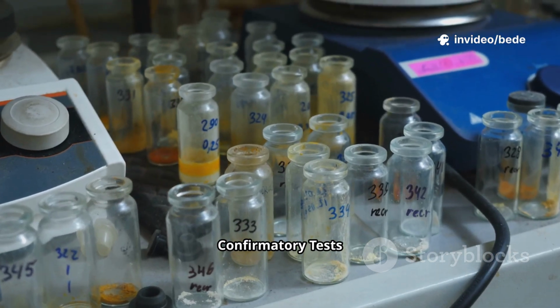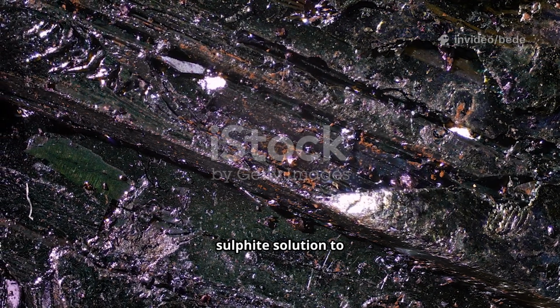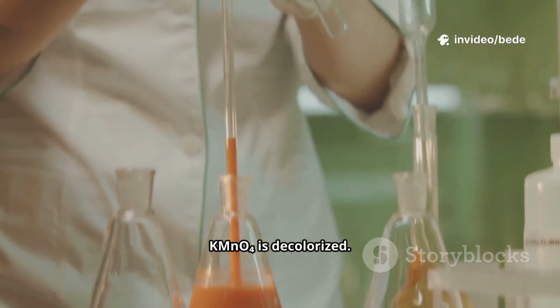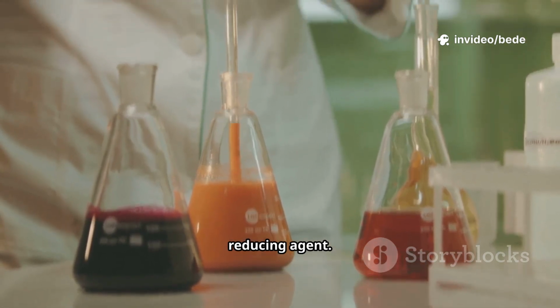Additional confirmatory tests for sulphite: 1. With potassium permanganate. Procedure: add the sulphite solution to acidified potassium permanganate. Observation: the purple color of KMnO4 is decolorized. Inference: sulphite acts as a reducing agent.